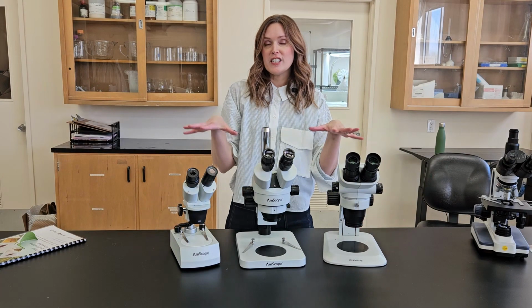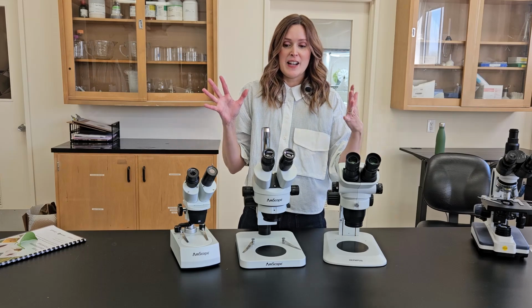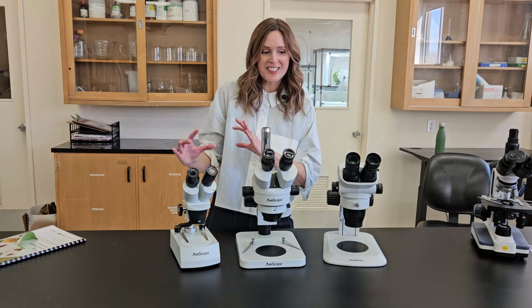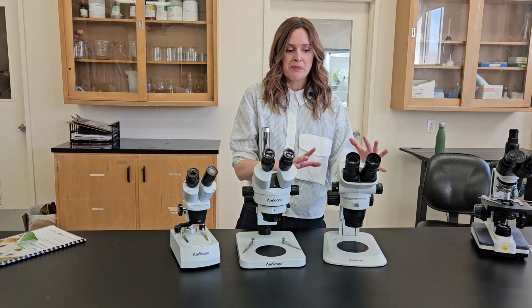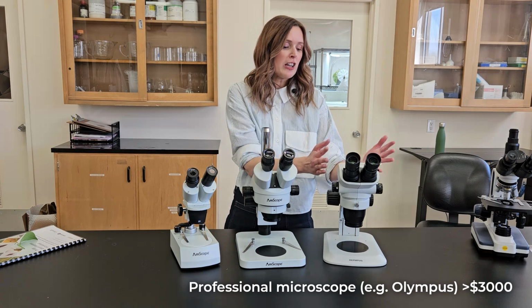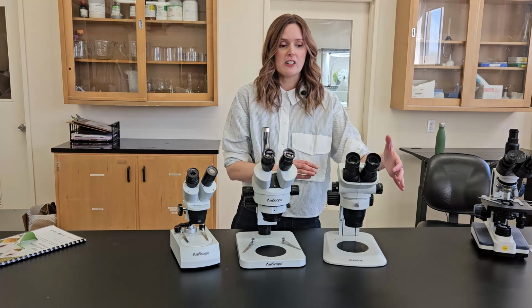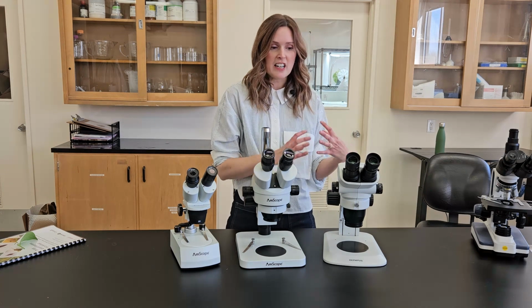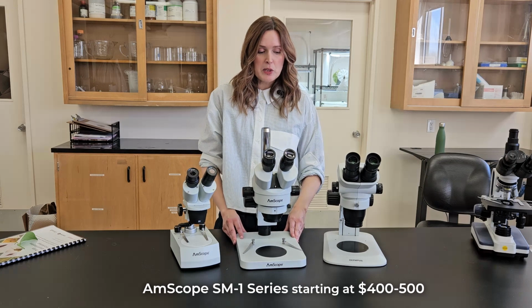There are a lot of different dissecting scopes on the market you can find online. We're going to walk you through them from highest cost to lowest cost, in terms of some of their features and things you might want to look for. This microscope that we use in the lab is a couple thousand dollars. Generally, we find it a bit of a sturdier build, and sometimes the ocular lenses can be a little bit crisper in terms of what you're looking at and the field of vision.